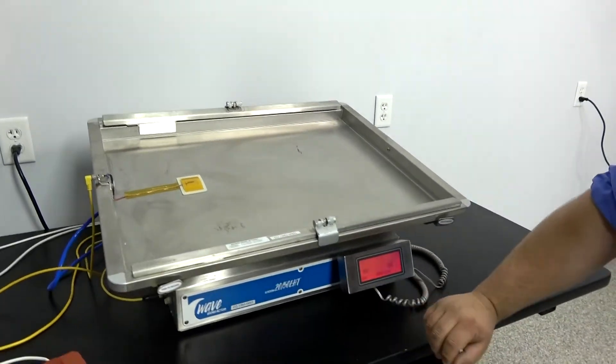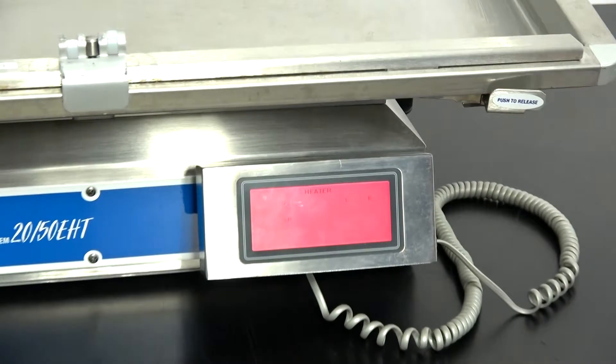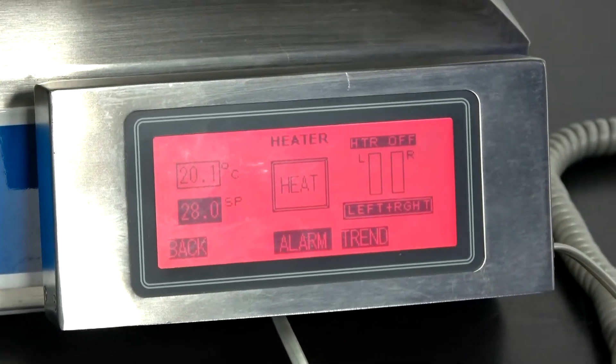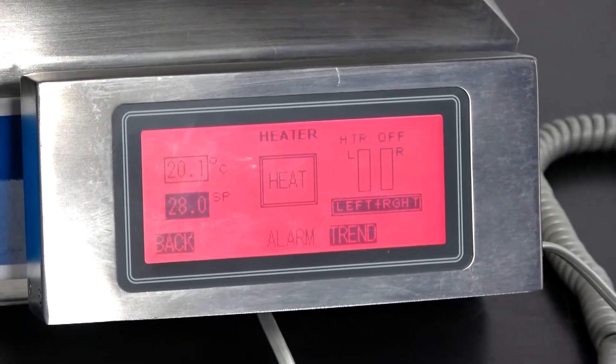And if we can show back down here in your heat controls, you can go to heater, and there would be all your heat settings for your table, and then here are your heater controls for the filter heaters.